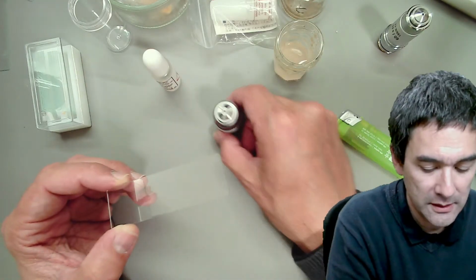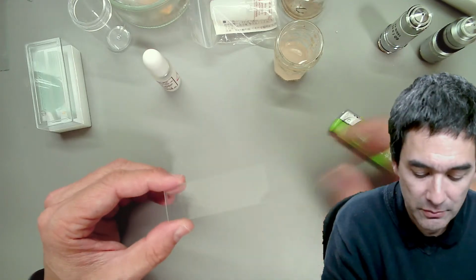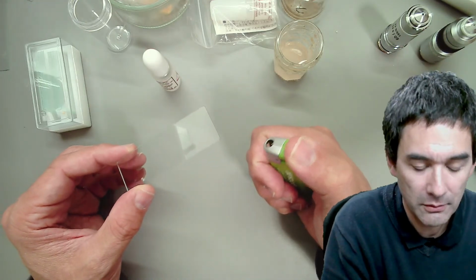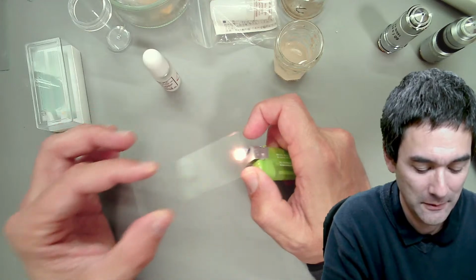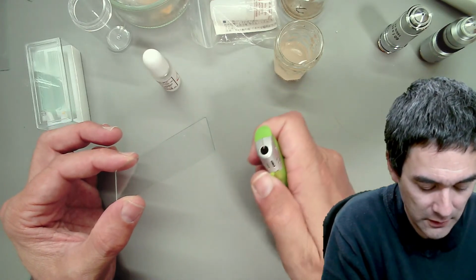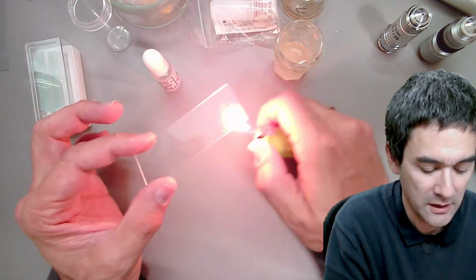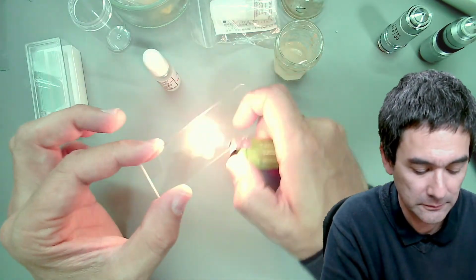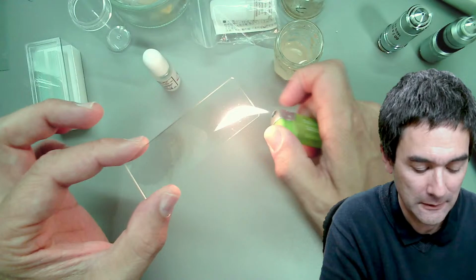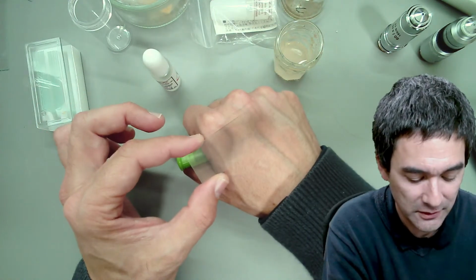I'm going to carefully take it out. Maybe I should engage the focus lock again. Okay, so I'm going to switch over here. And instead of using a Bunsen burner, I'm going to use this here, a lighter, hoping it's not going to crack. Yes, that's better. No, not hot enough. Ah, I touched it. See, and now there is soot on here. Not a good idea.